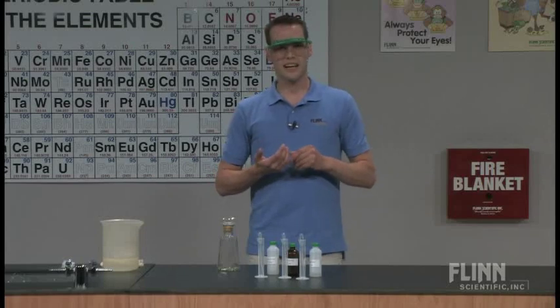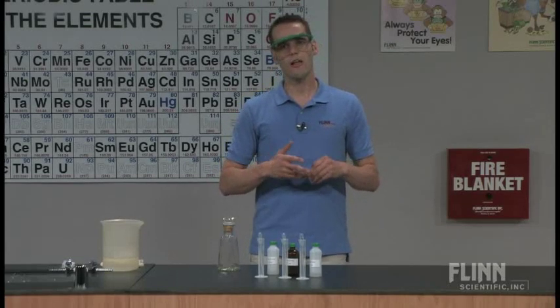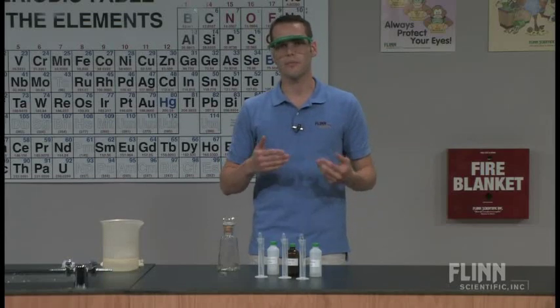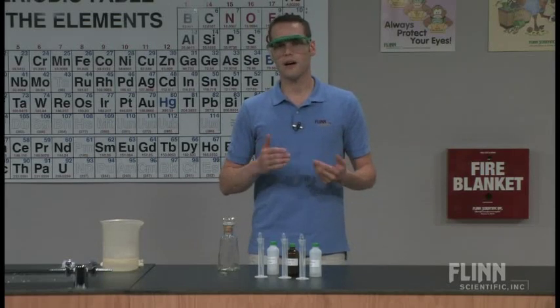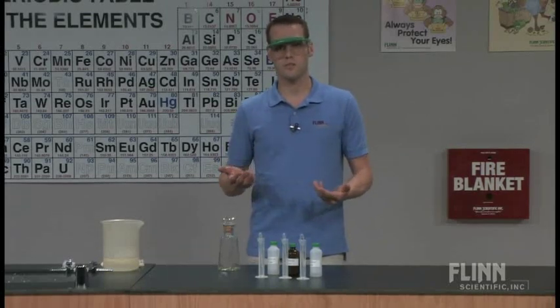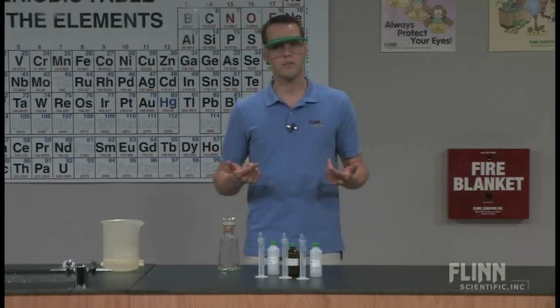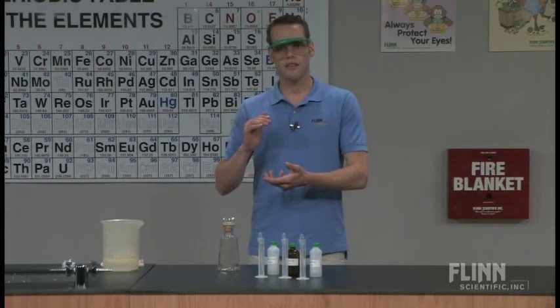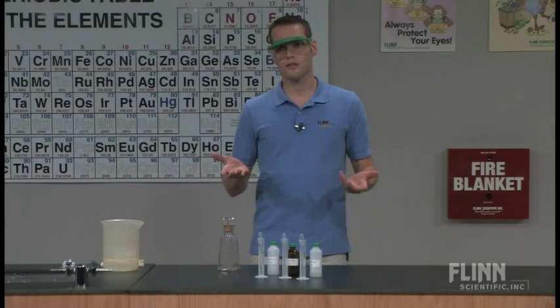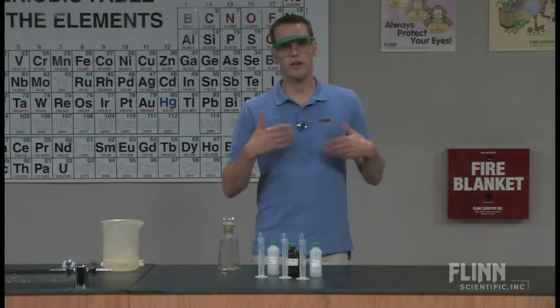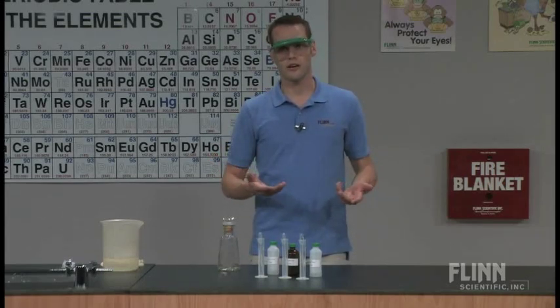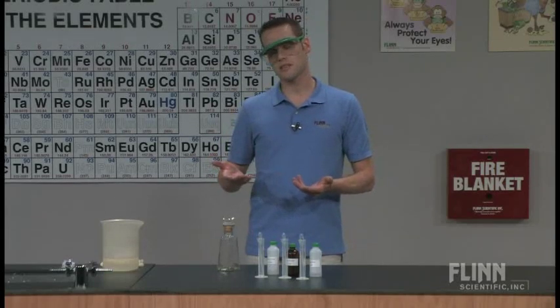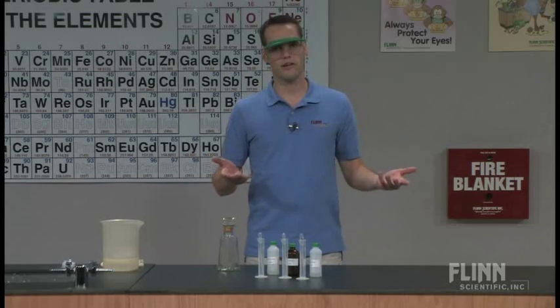The old recipes that I saw for the silver mirror were really tedious and they all had to be made fresh because some of the reagents degraded over time. The recipe that you have in your handout is a much better recipe that was given to me by a teacher who taught an AP workshop. This recipe can be stored in solution on your shelf and brought out year after year after year. So I find this process a lot handier, it's much less setup for me.